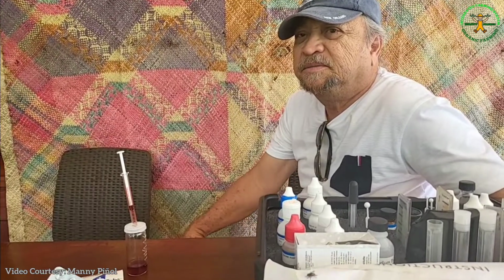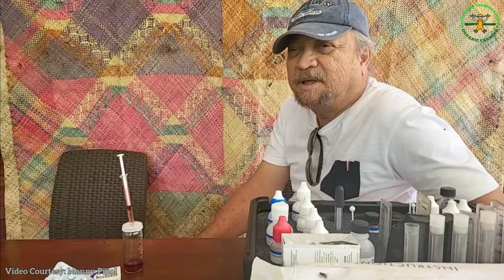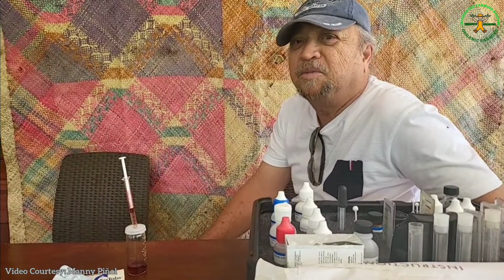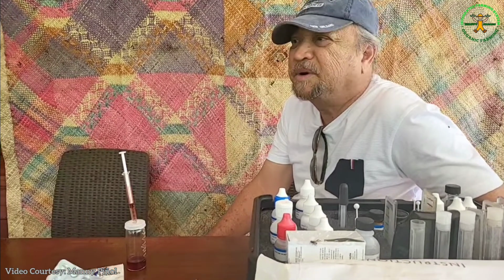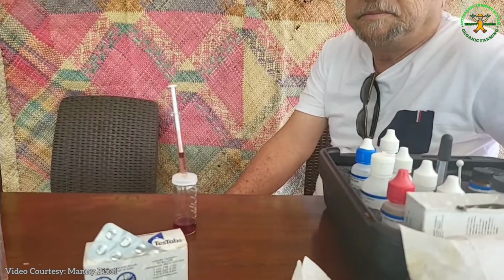You run into serious problems. Okay, so that's a very basic requirement, if you have common sense. Number one requirement. So this is the simple alkalinity test conducted by Rocky French and Joyce.